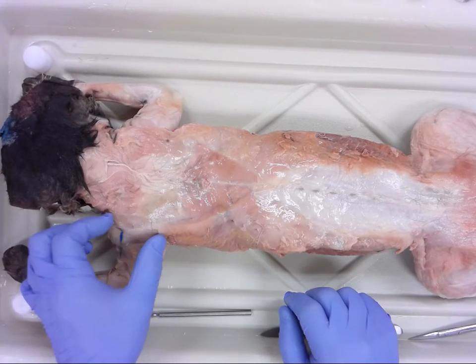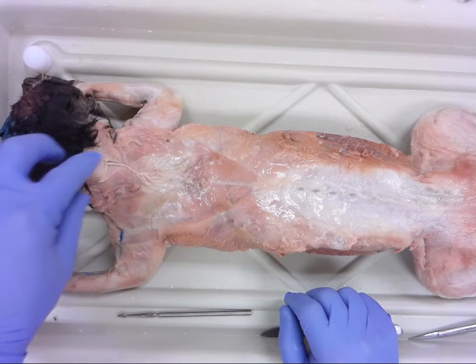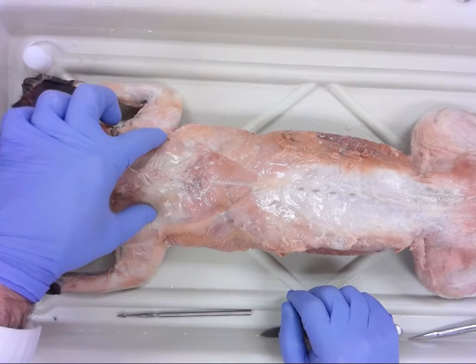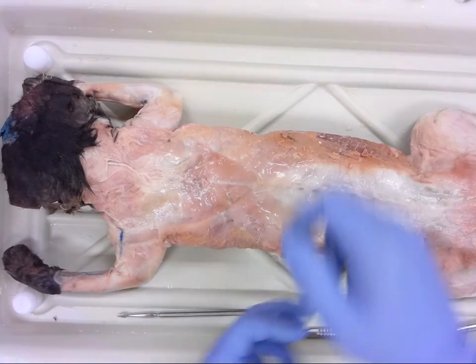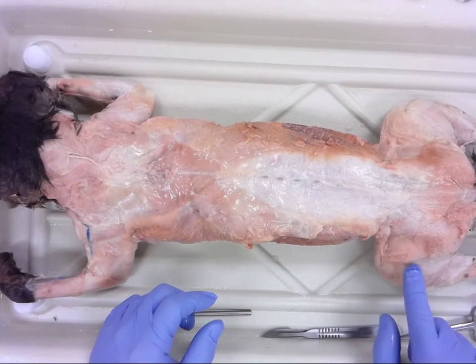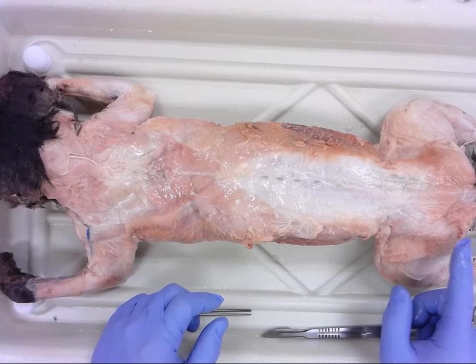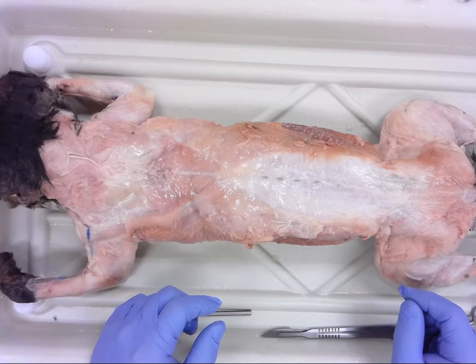So we will have the back of the forelimb, or upper forelimb, and we will have muscles in the neck, middle of the back, as well as the larger latissimus dorsi. Time pending, with the lower limb or hind limb, we will take a look at some of the gluteal muscles, but that will depend on how much time we have.